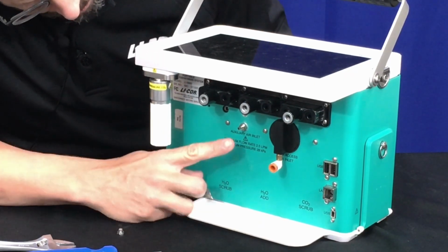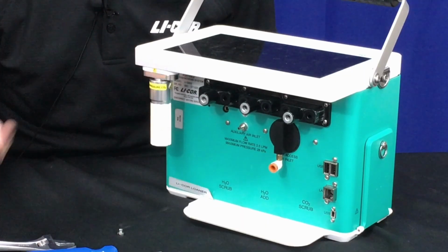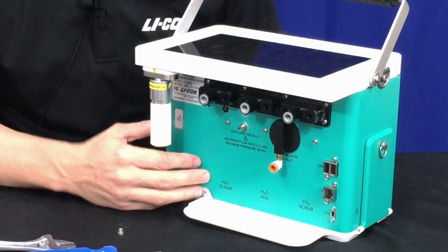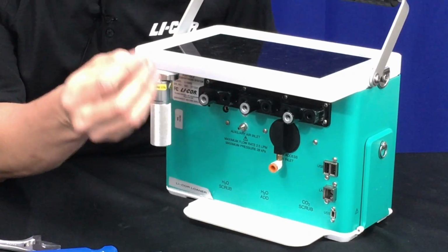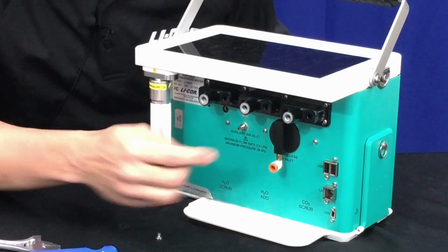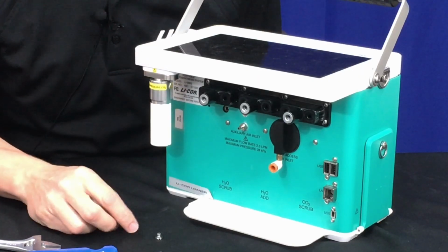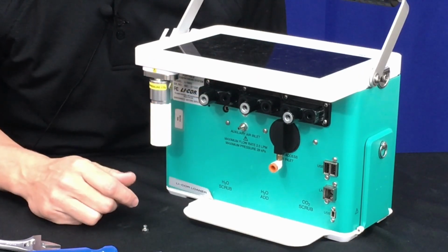One quick note about using the auxiliary air inlet. If you or a colleague were to want to use the instrument without using the external air supply, to return to the normal method, then you would need to remove that hose barb and replace that plug. Without doing that, all of the air, when the pump is on, will exit that port and not be presented to the sensor head. So make sure you have that plug in place when using it for typical operation.